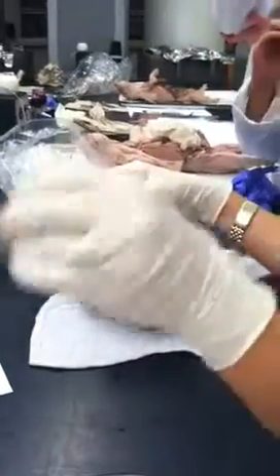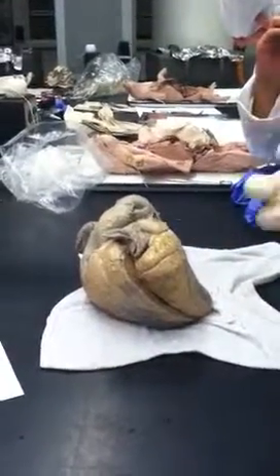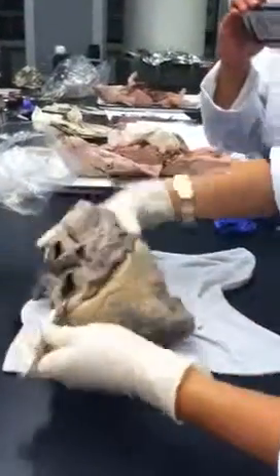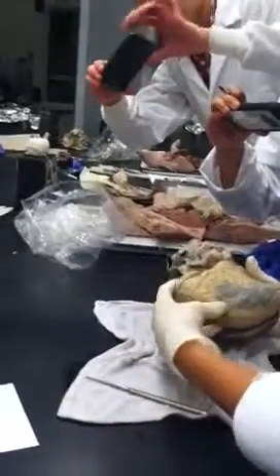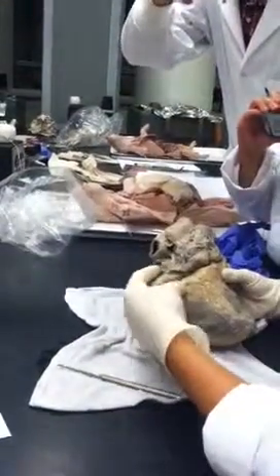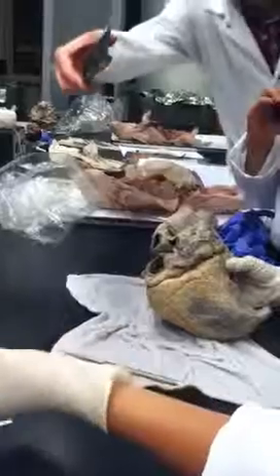So it goes to the lungs, gets oxygenated, and it's coming back through the pulmonary veins, right? All the pulmonary veins come together into one big pulmonary vein, and then they dump into the heart right here. If you're looking at the back side of the heart, the pulmonary vein entrance is the leftmost hole. I say that because sometimes people look at the back and think, holy crap, there are so many holes. The leftmost one is the pulmonary vein. It's big, it's really big.